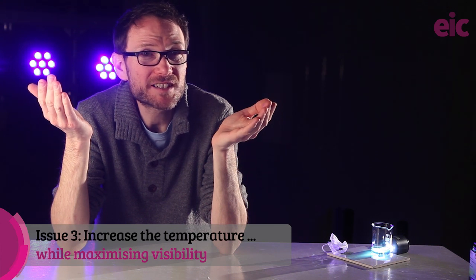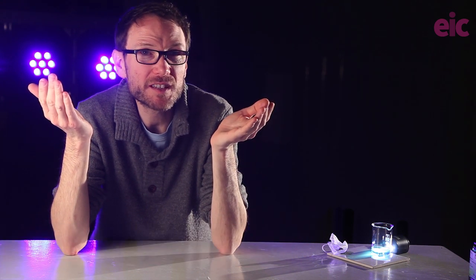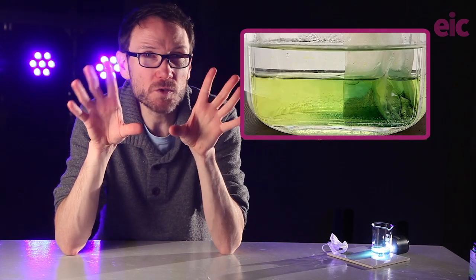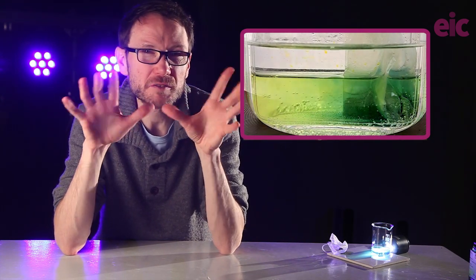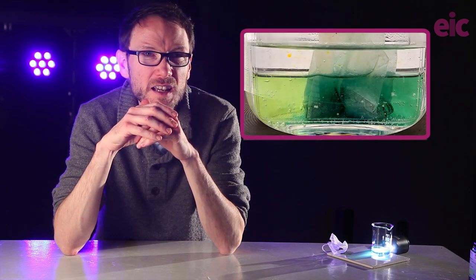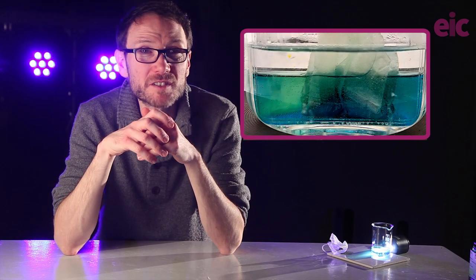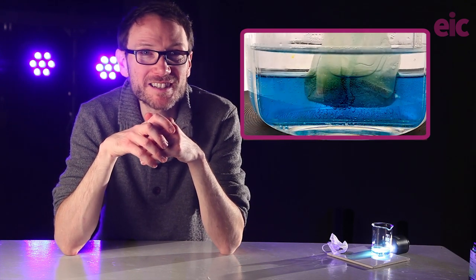I had been reluctant to use a water bath for fear that it would make it difficult to see the nuances of the reaction, but responses from this community, this fantastic community, overwhelmingly pushed me over the line to return to the idea of heating up the solution. So here I am trialing for the first time in a water bath, but just below a simmer, somewhere between 80 and 90 Celsius, and the speed difference is worth the investment. We're well below 10 minutes now.